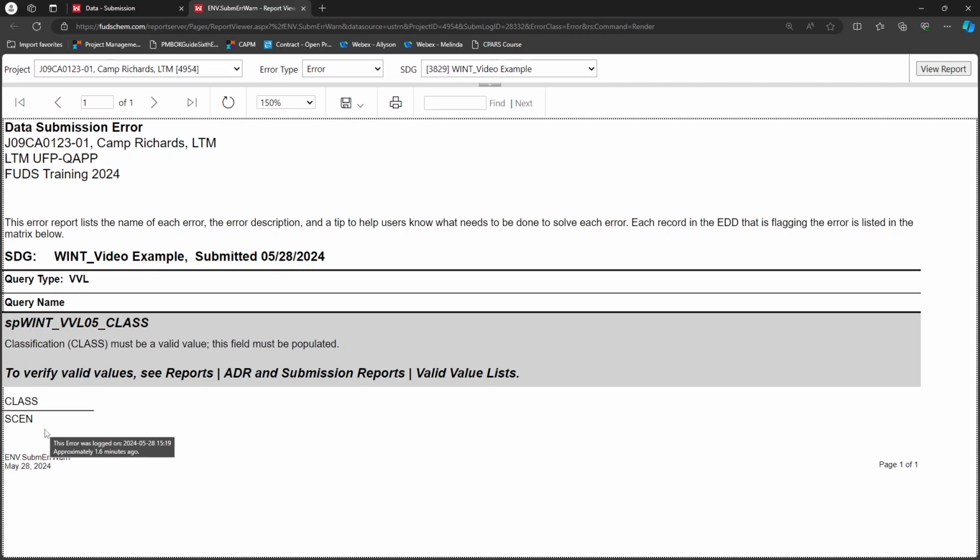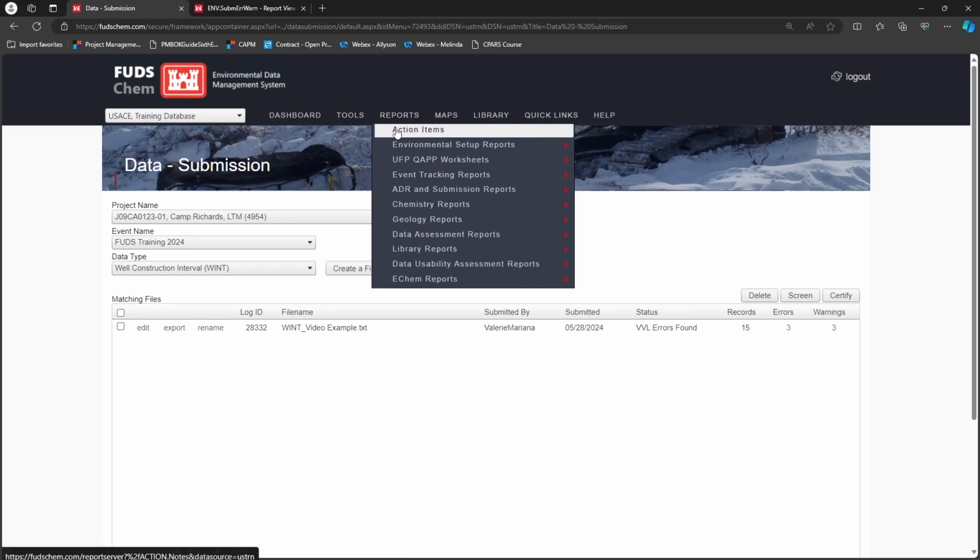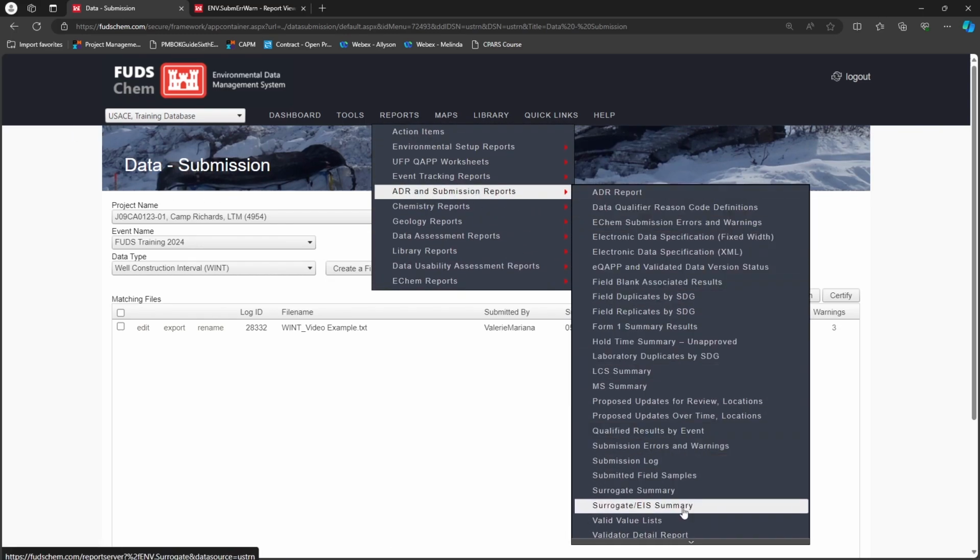In this case, the error report says the problem is with the class being set to SCEN, so SCEN must not be a valid value. To review the valid values, we will go back to our main tab, then go to Reports, ADR and Submission Reports, Valid Value Lists.